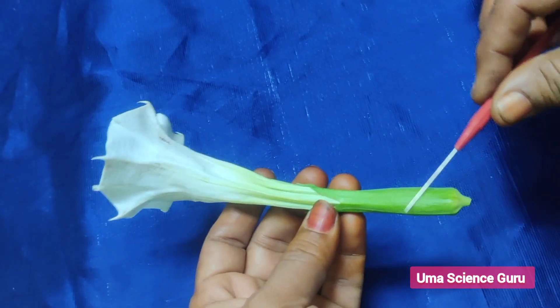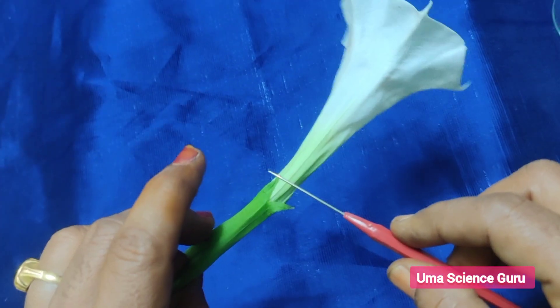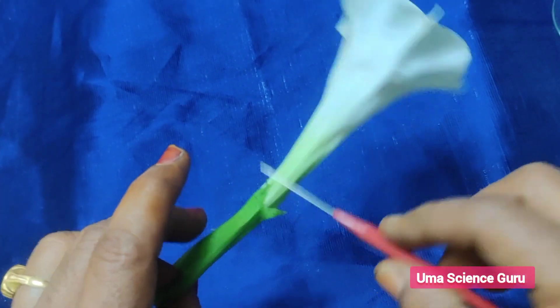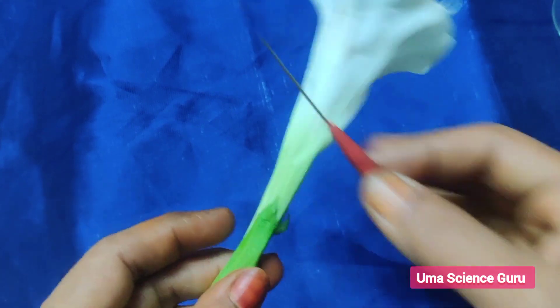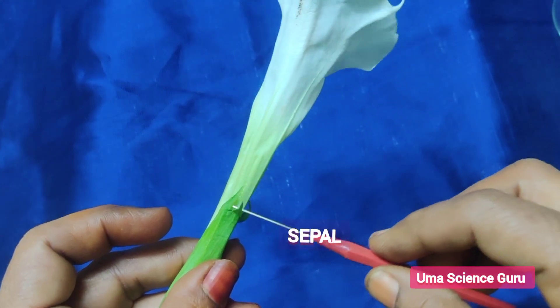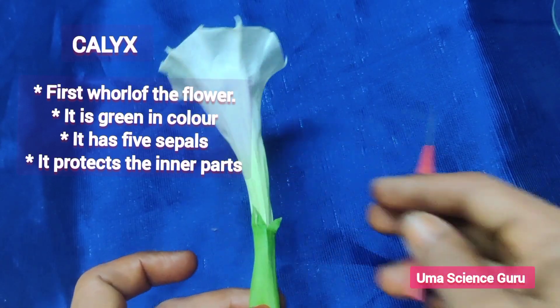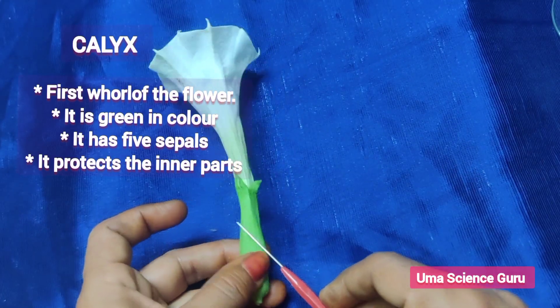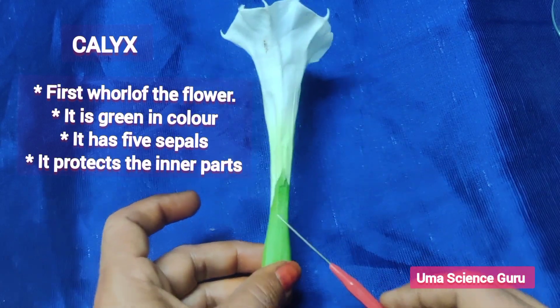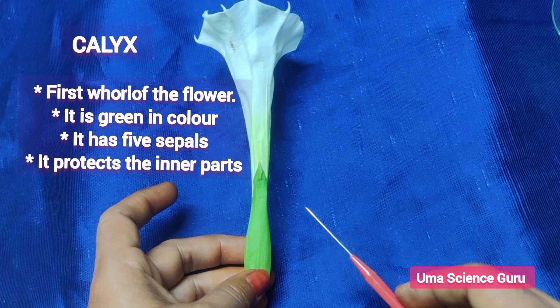Usually there are four parts in the flower. The green cup-shaped leaf-like fused structures that cover the internal parts are sepals, collectively called the calyx. The calyx is the first whorl of the flower. It is green in color, has five sepals, and gives protection to the inner parts.